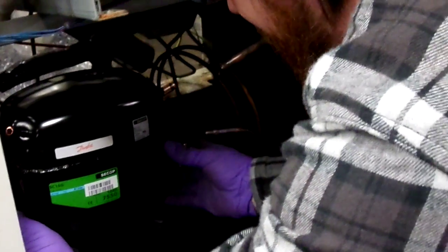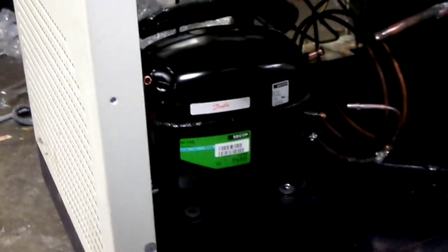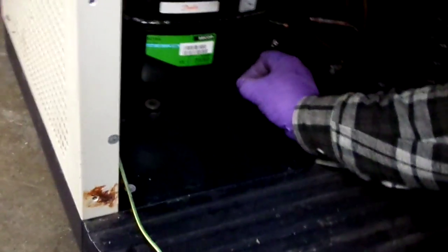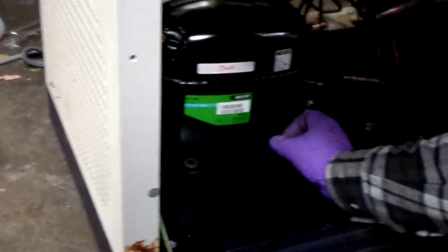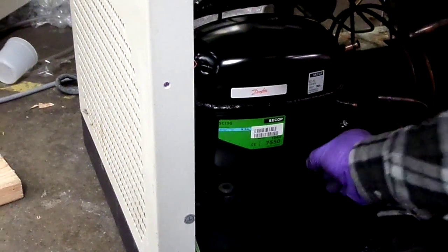So before you do any sort of fitment, you get the thing in place. Got your little spacers. This actually keeps it from, when you tighten your bolt on there with the washer, it keeps it from tightening all the way. So you can see that it doesn't go all the way down. It keeps it so it's rubber mounted. It decreases vibration in the machine itself, so you're not vibrating when you're trying to work with it.